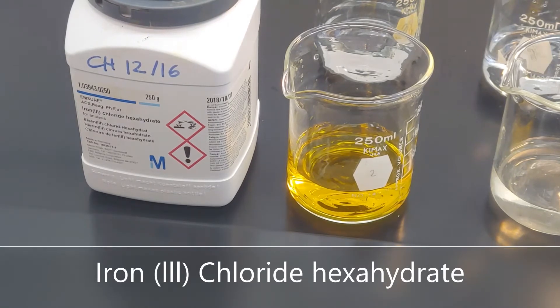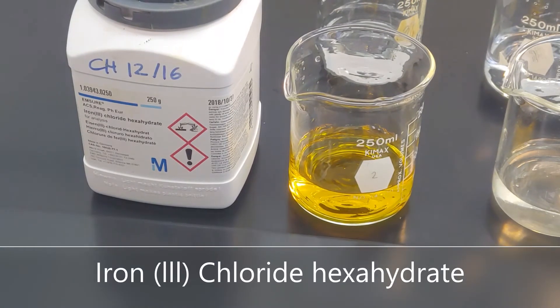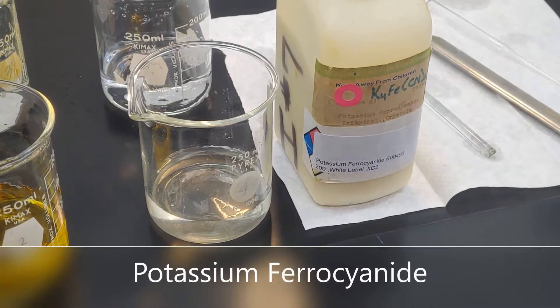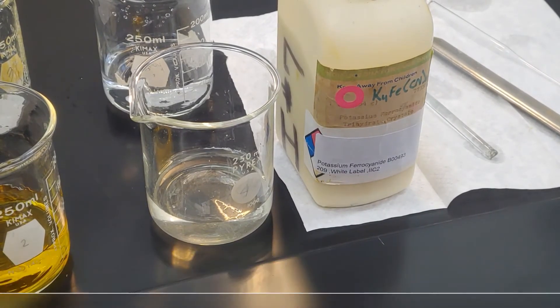Here you can see the characteristic yellow color of ferric chloride hexahydrate. Potassium ferrocyanide has a clear, transparent color.